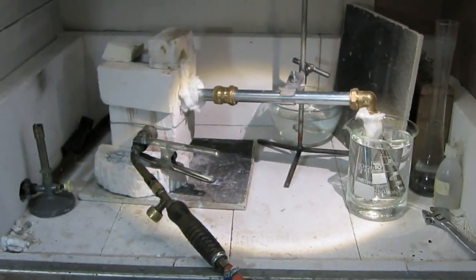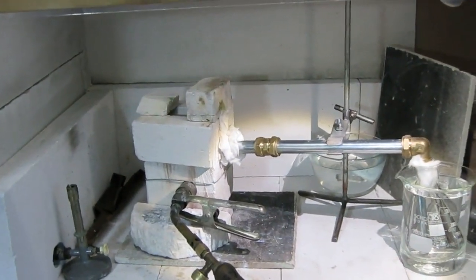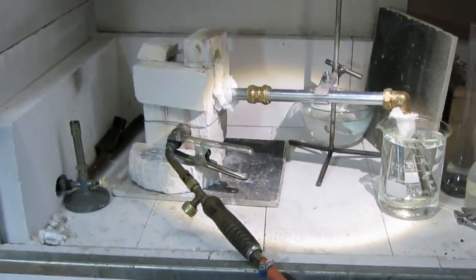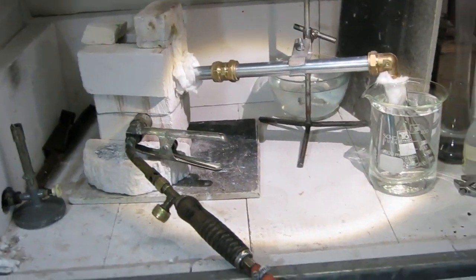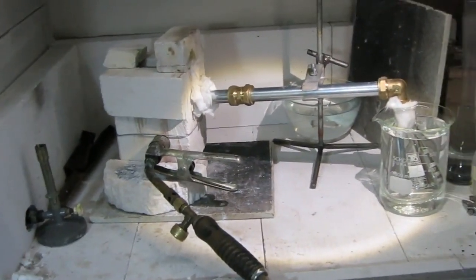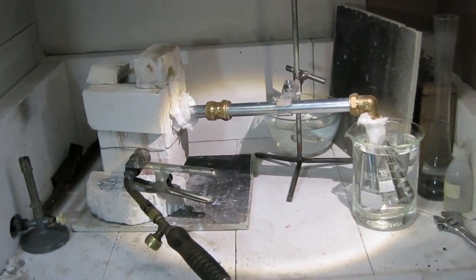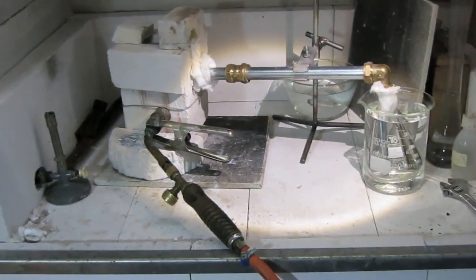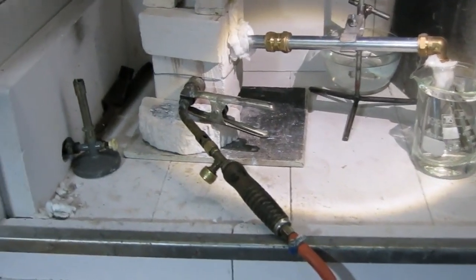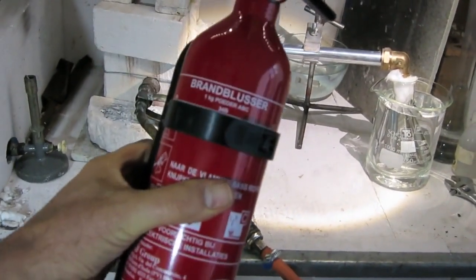I'm going to make some carbon disulfide, CS2, from carbon and sulfur, from the elements. This is first a warning. Carbon disulfide is very toxic and flammable, so this experiment only in a fume hood or outdoors, and have always a fire extinguisher ready.